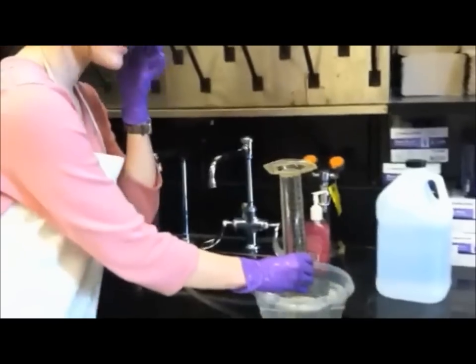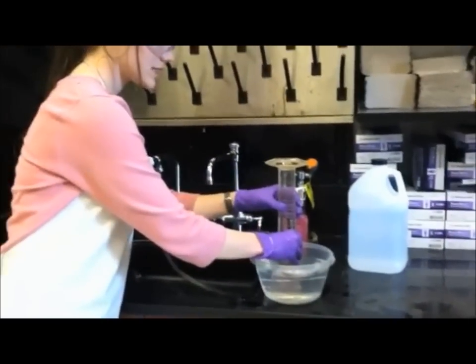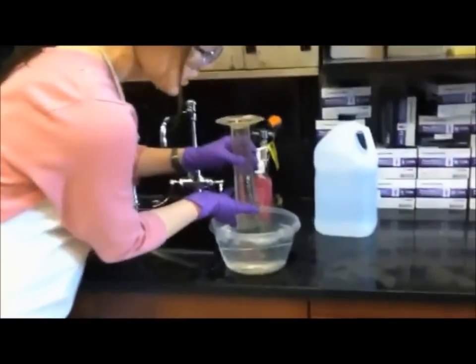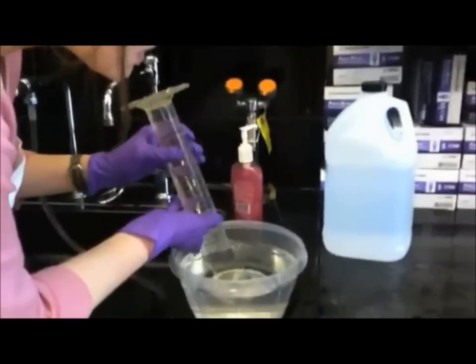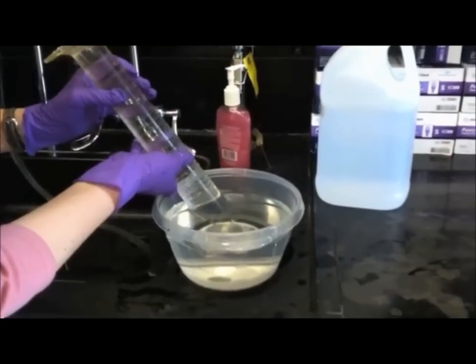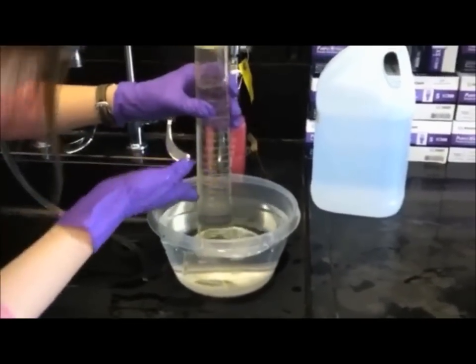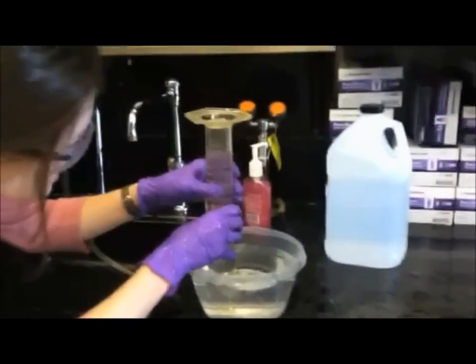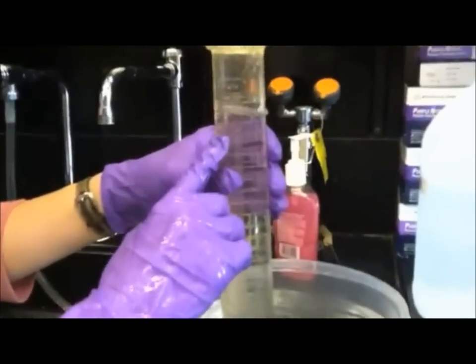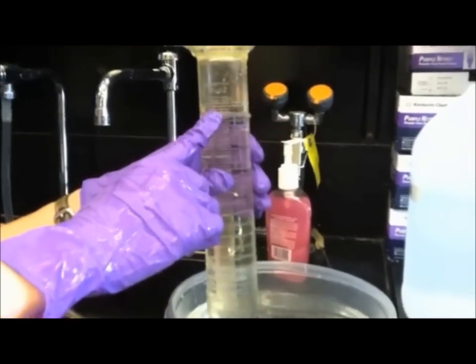However, if you were to get any air bubbles in, the way that you can make sure this is okay is if you gently lift up the nose of the graduated cylinder to capture a small air bubble. And now you can see that it's at the tick marks and you will be able to measure your initial volume.